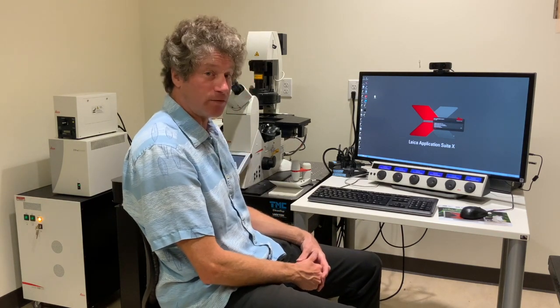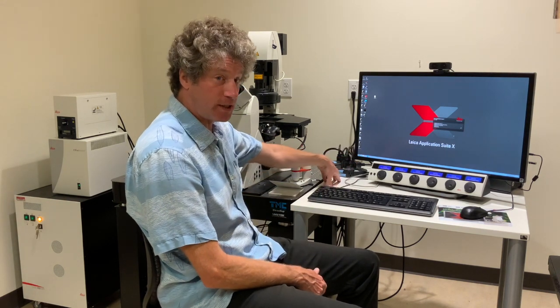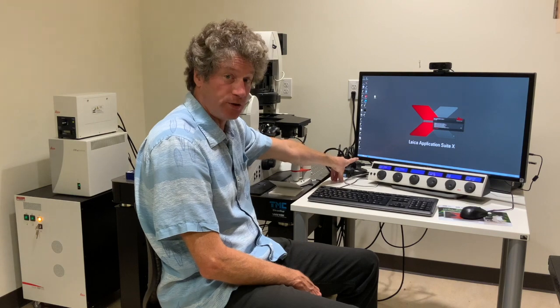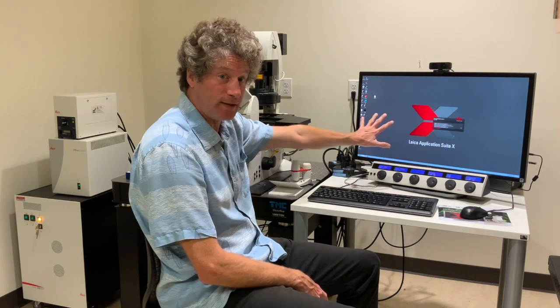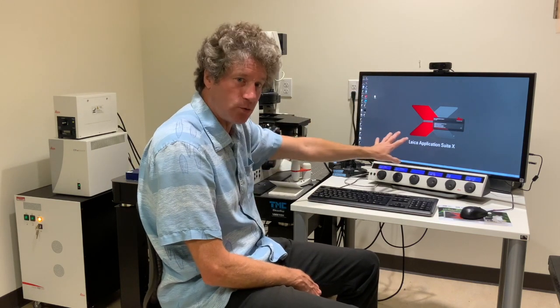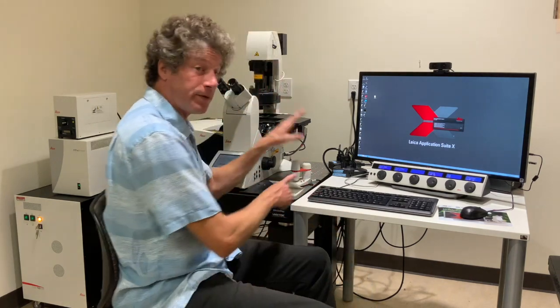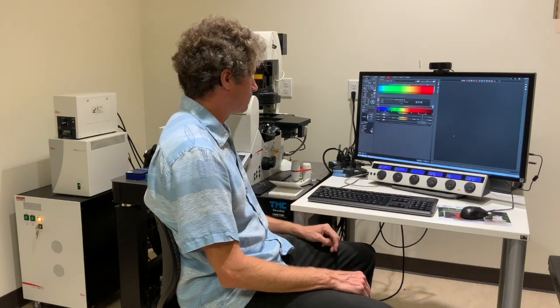That's the easy part of the Leica SP8. At the end I'll do a shutdown procedure, but it's basically: turn off the software, shut down Windows — you don't turn off the power with Windows running because that just kills Windows. So shut down the Leica software, shut down Windows, shut down the machine, then turn off the power. You can turn them both off at once — all of the power for everything is on these two strips.